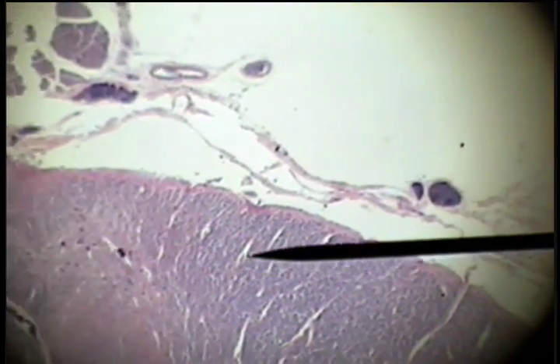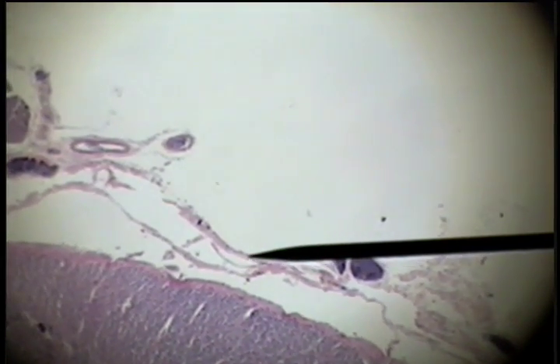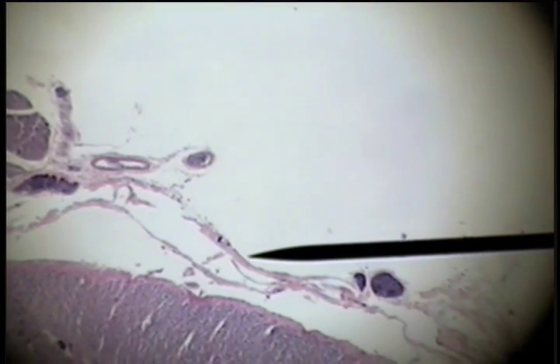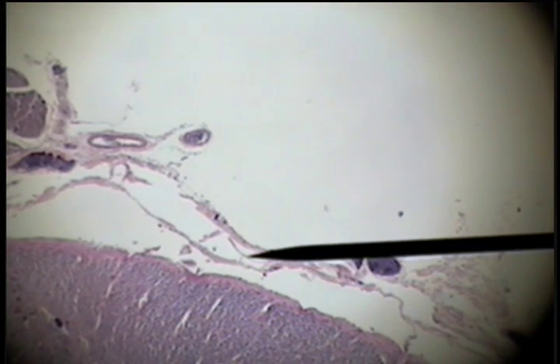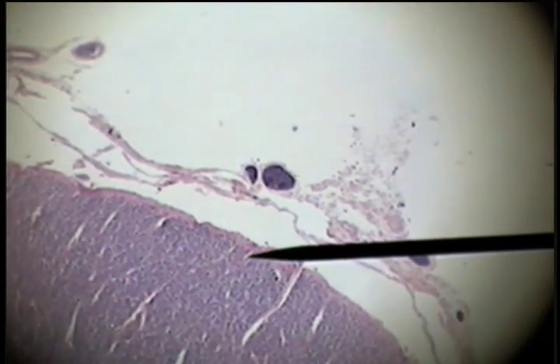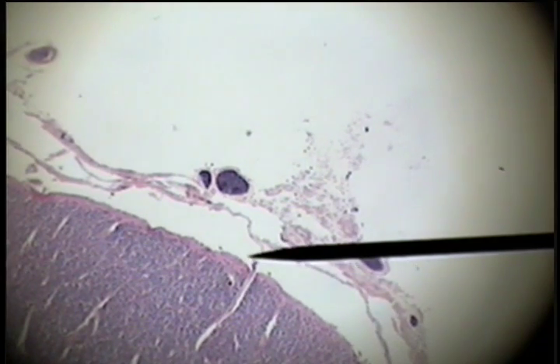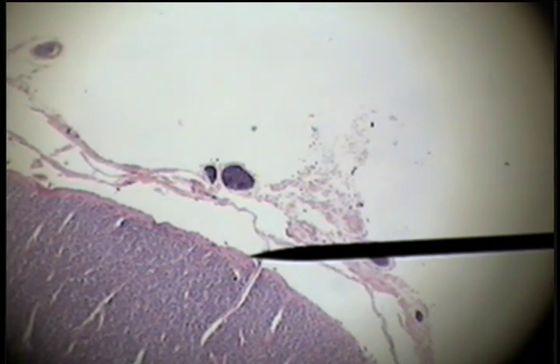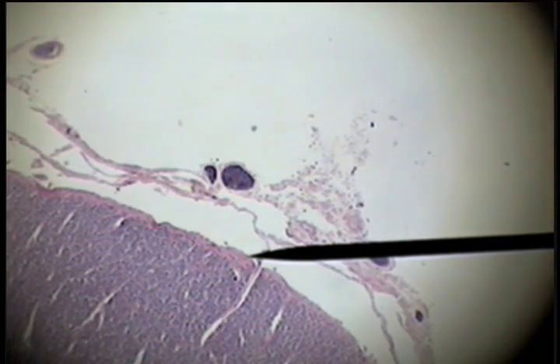Let's go to the outer coverings of the cord. This outer covering is thick — that's the dura mater. Then underneath that is the thinner arachnoid, which looks like cobwebs. Here's an arachnoid going down to the surface, and right on the surface is the pia mater, the third of the three meningeal layers.